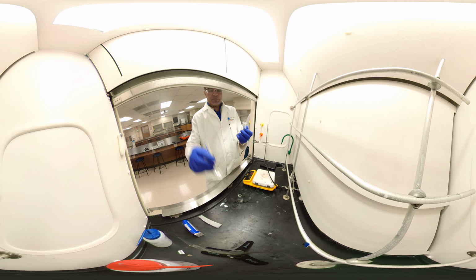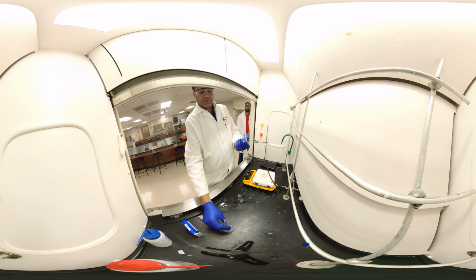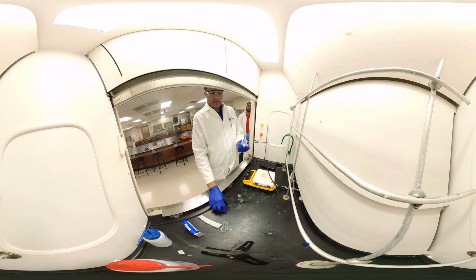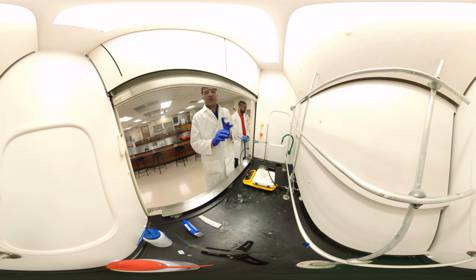Here, I have 8 milliliters of dichloromethane. I added it here. And what happens here? Out of 4 components, 2 components, aspirin and caffeine, are soluble in dichloromethane. The other 2 are insoluble. So we'll warm this up for a while on the hot plate, and while heating, we'll cover it with the watch glass. We just warm it up. Once we warm it up, the aspirin and caffeine will be dissolved, and acetaminophen and binder will be the solid. We'll filter it, then we'll separate the 2 parts, and we'll go from there.